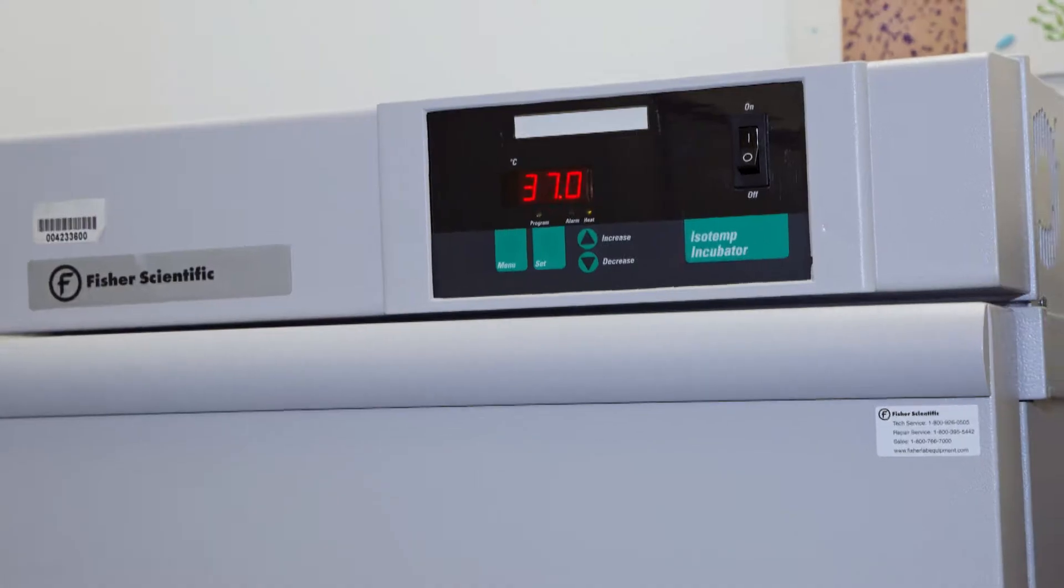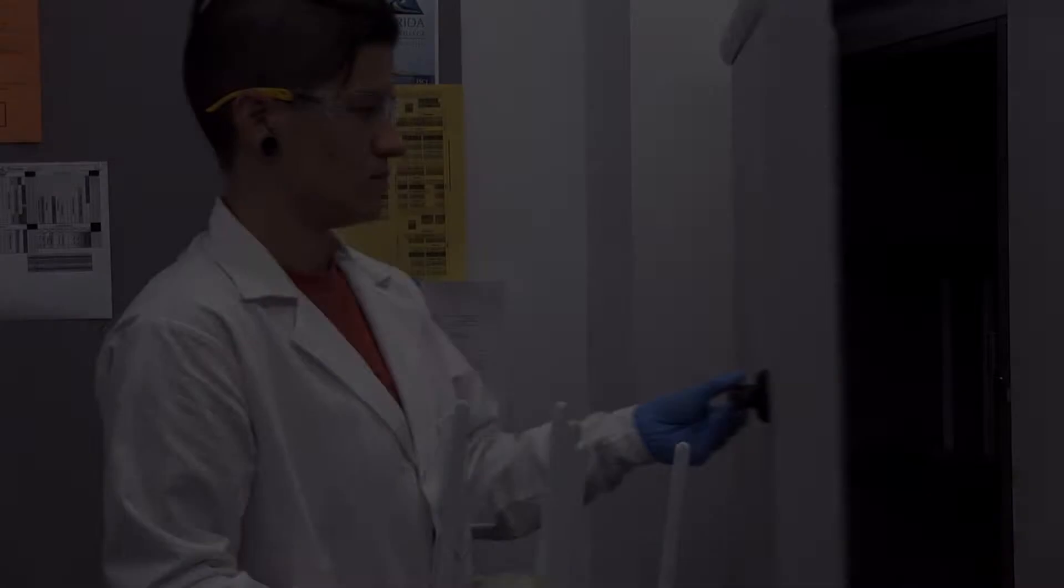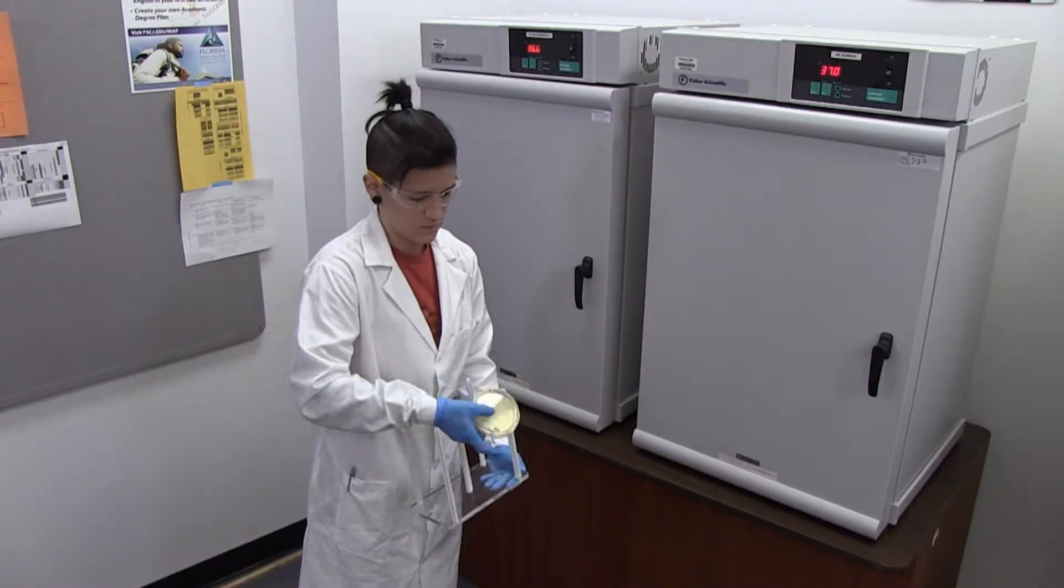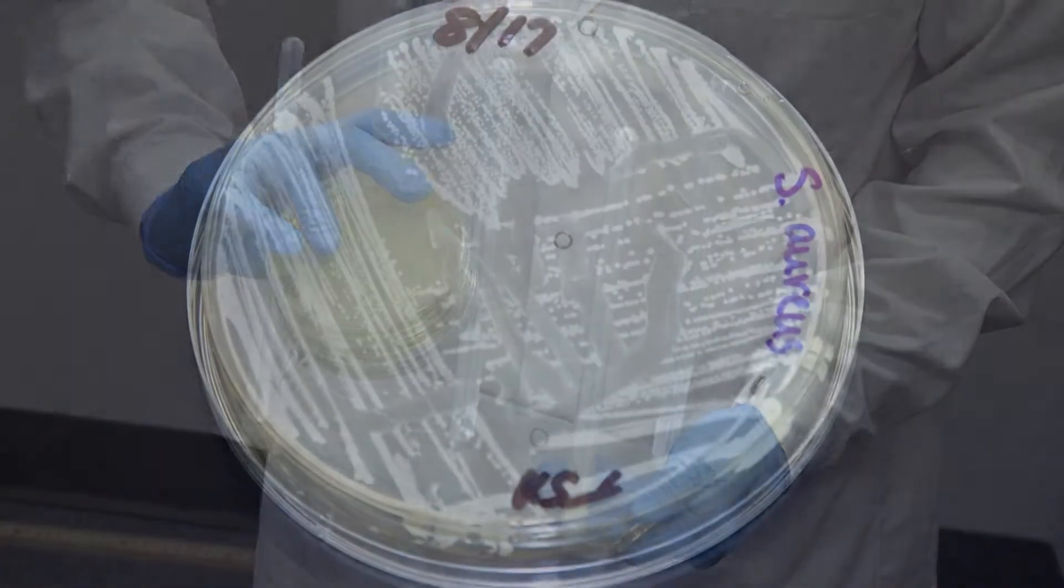Results. After incubation at 35 to 37 degrees Celsius for 16 to 24 hours with the bottom up, the plates can be observed for isolated colonies.